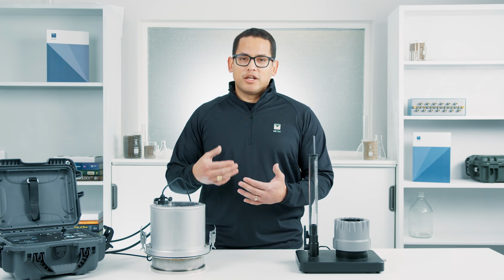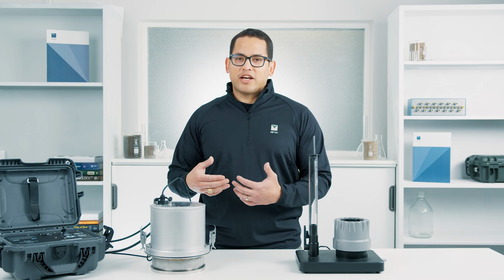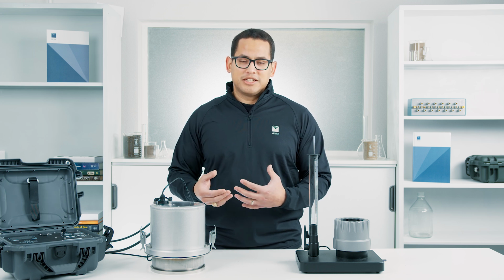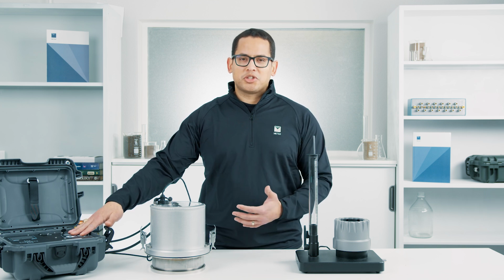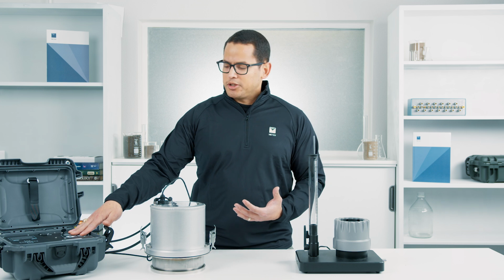If the soil is closer to field capacity initially, typically the measurements are a little bit faster, but also soil texture can play a role there as well. Finer textured soils like clay can tend to take a little bit longer to make a measurement and get to that steady state value. But what's nice about this is when it's done, it actually does all of the calculations on board to do the corrections for three-dimensional flow and give you a final field-saturated hydraulic conductivity.